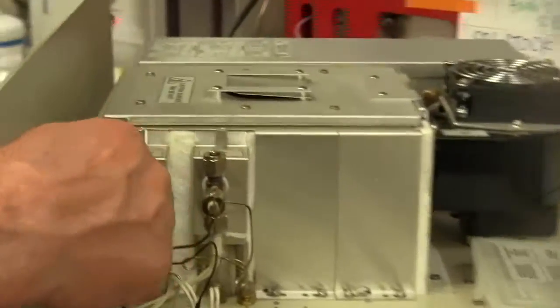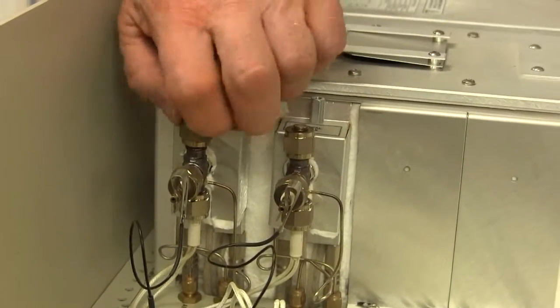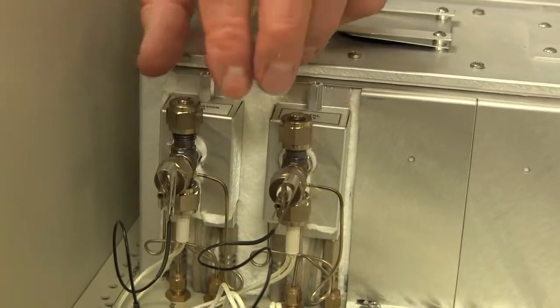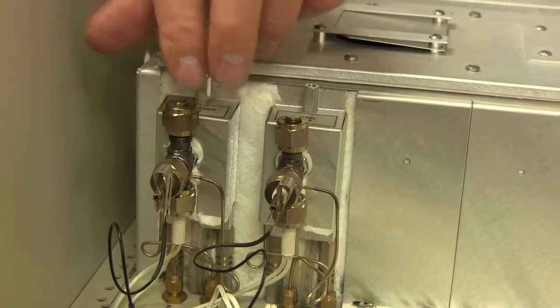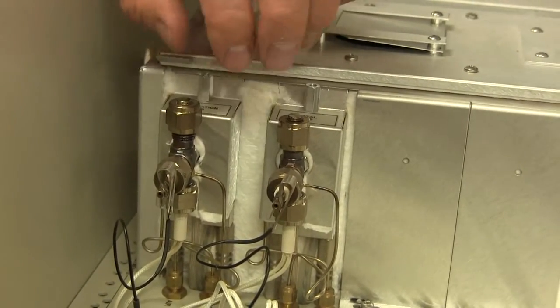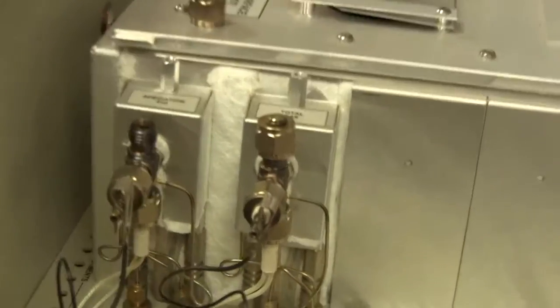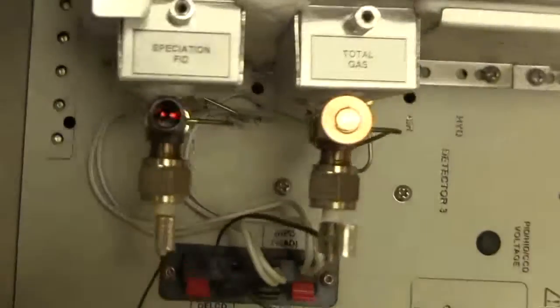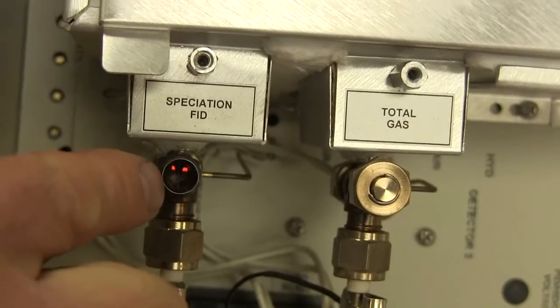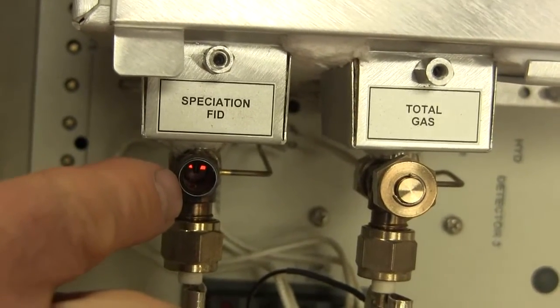So inside the FID, something has to ignite the flame, and we call that little thing an igniter. So if you remove this cap at the top of the FID, and be careful because it's frequently extremely hot, so you may have to use gloves, or you may have to just touch it for a second the way I'm doing it. Don't burn yourself. But if you look inside, you can see this igniter. You see this red glow that's buried kind of down in the detector body? Well, that's the glow that makes the flame light.